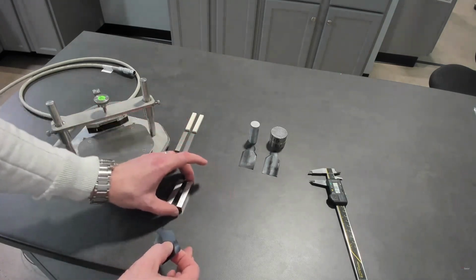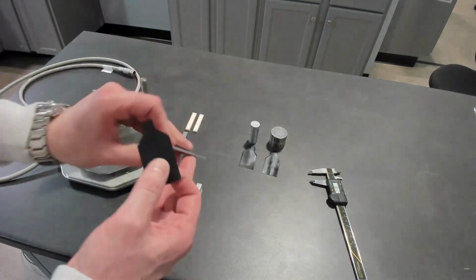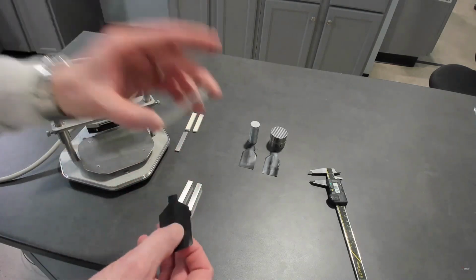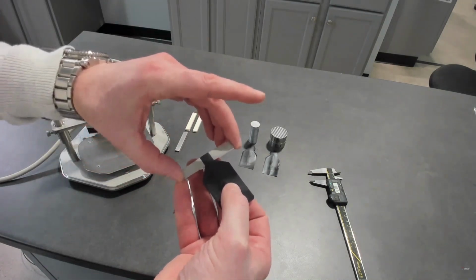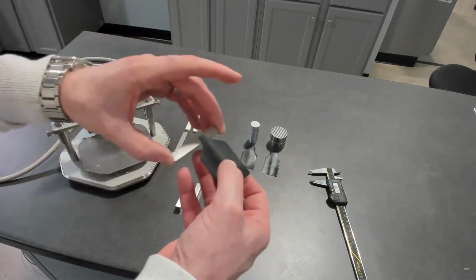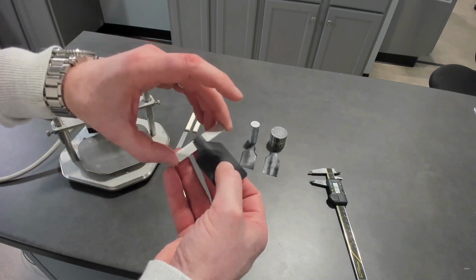But let's say your sample is very thin, but it's still a strip, let's say half a millimeter to 3 or 4 millimeters thick, and you still have the ability to run transient hot strip, and one of the dimensions fits one of the dimensions of the strip sensor. So in this case, 10 by 10, and this sample is roughly 10 millimeters.